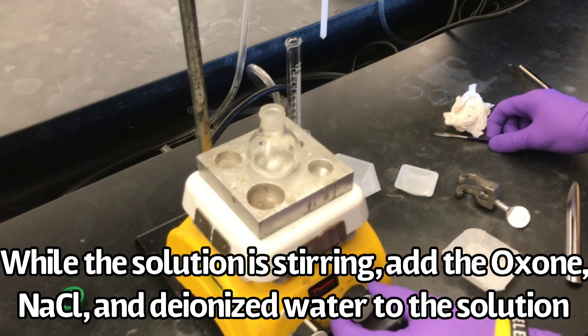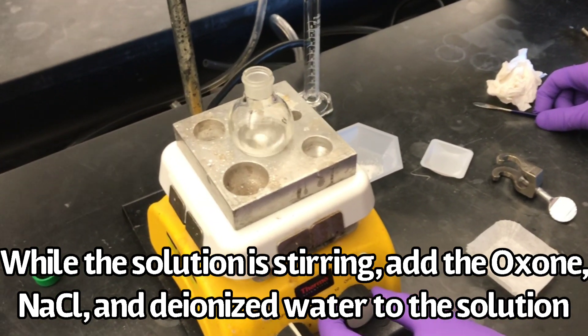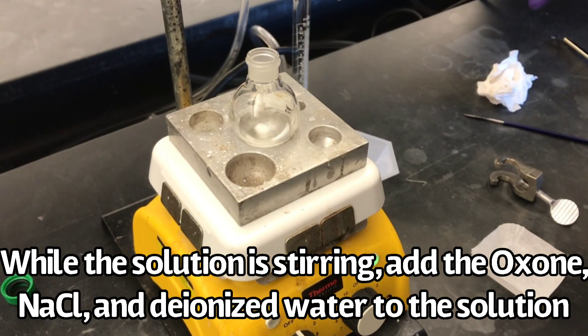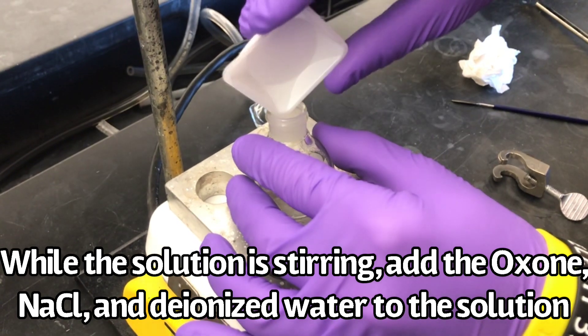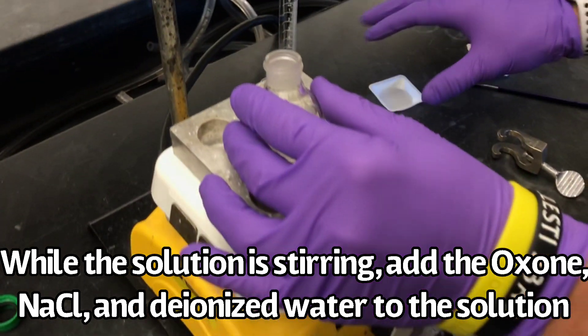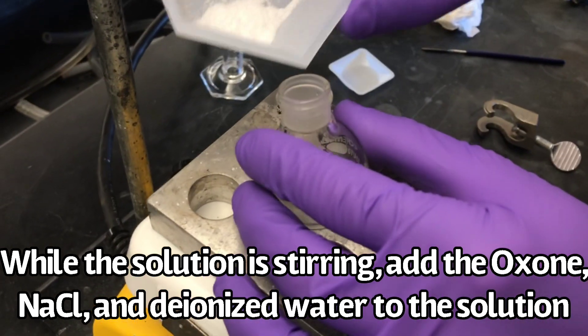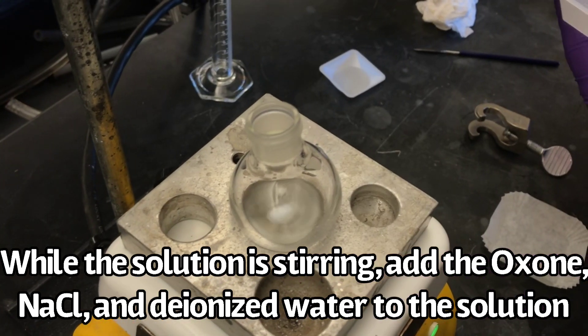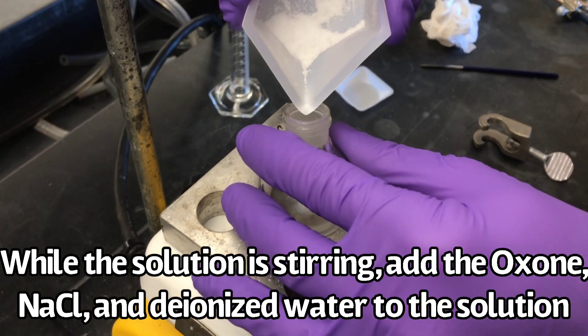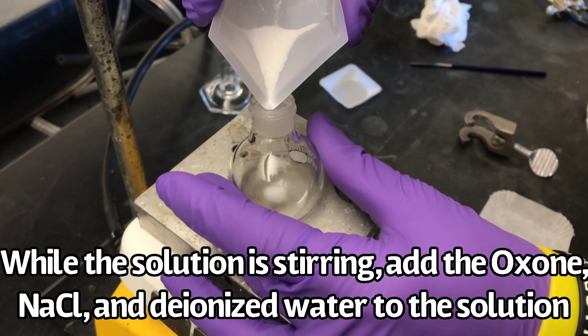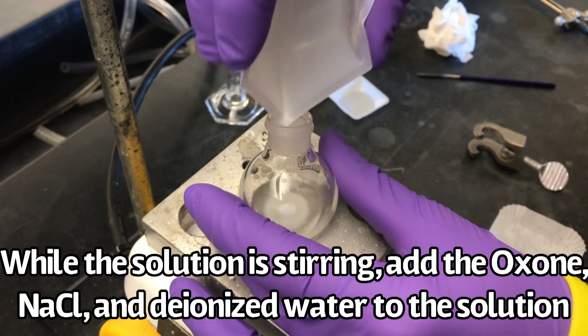This will create a biphasic mixture. Let the solution stir for 45 minutes.